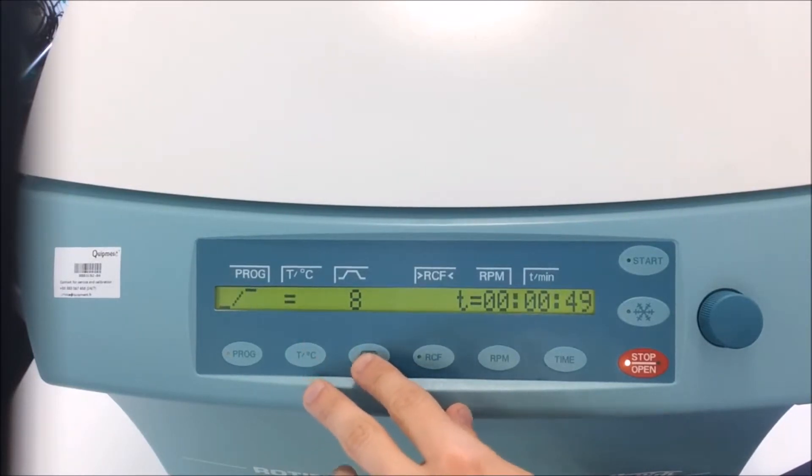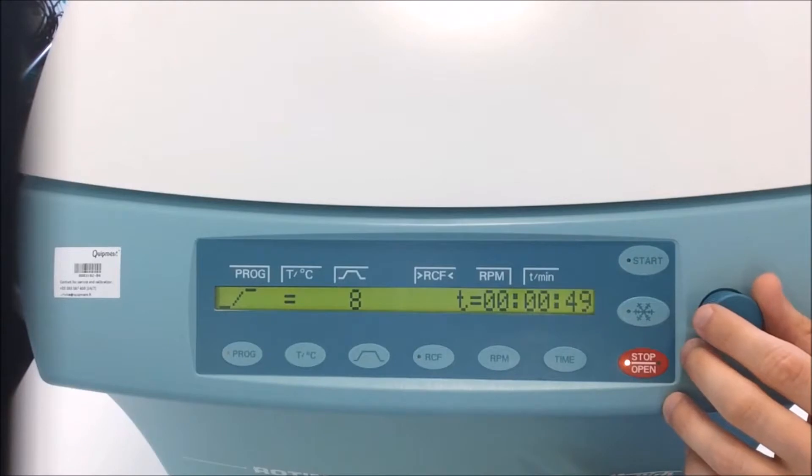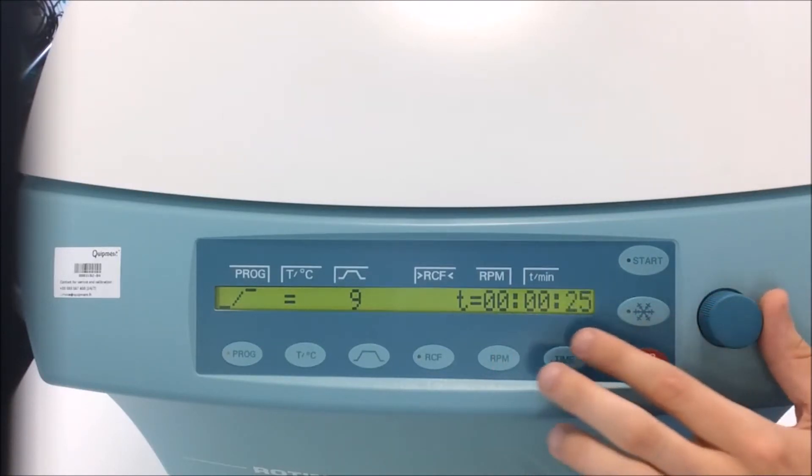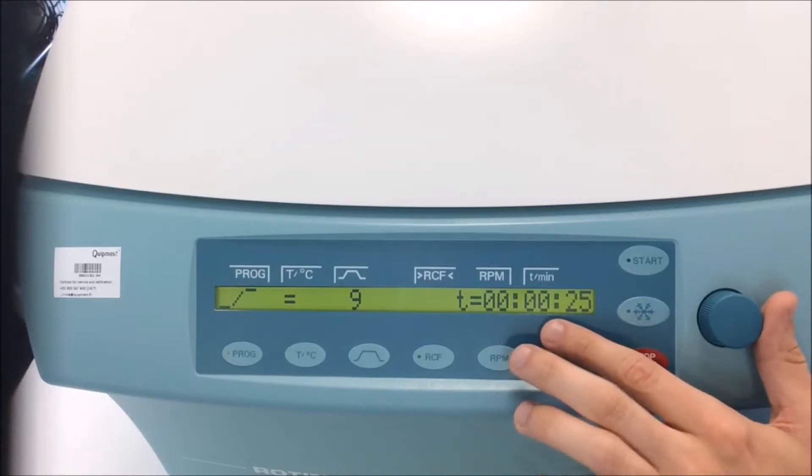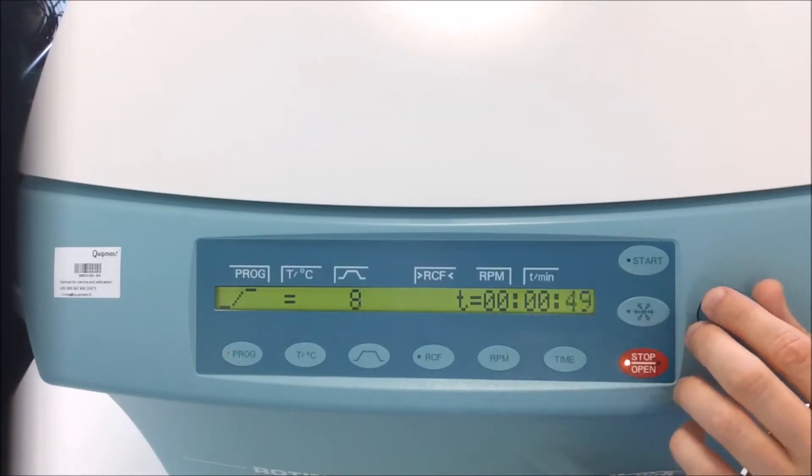The start-up and run-down parameters can be changed too. 9 is the shortest duration for start-up, so I will use this one.